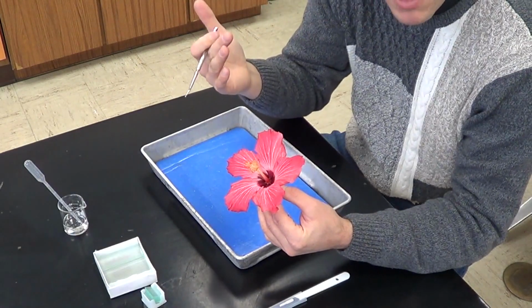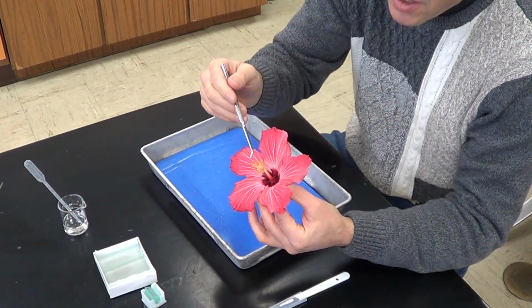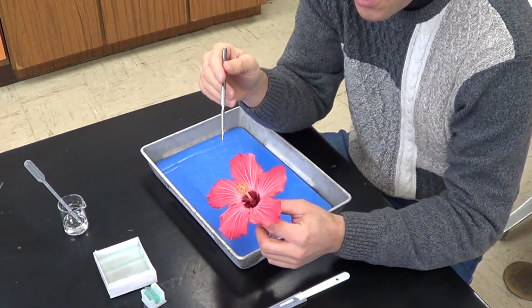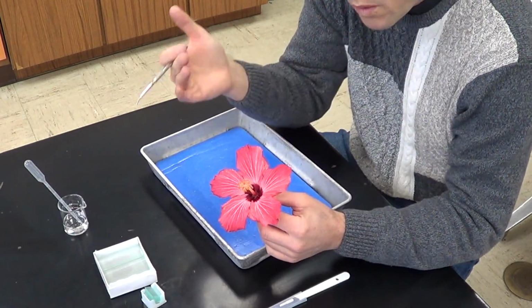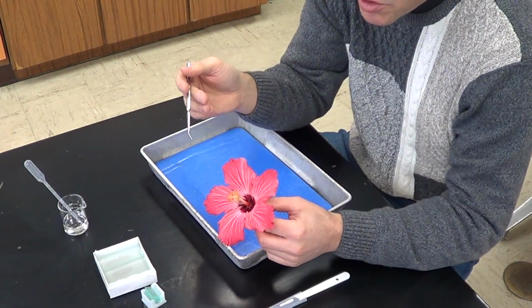The anther actually makes the pollen, which contains 2 sperm. And you want to hold that up high so that the wind can blow it or an insect has easy access to it. The next structure, the innermost structure, is going to be the female part of the plant, called the carpel or pistil. It goes by both names. And it consists of 3 parts.